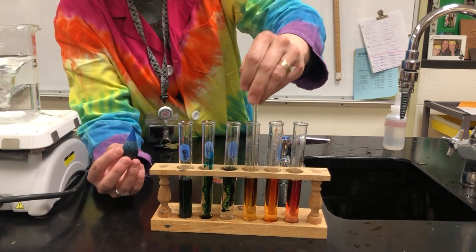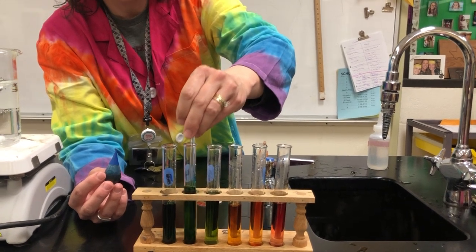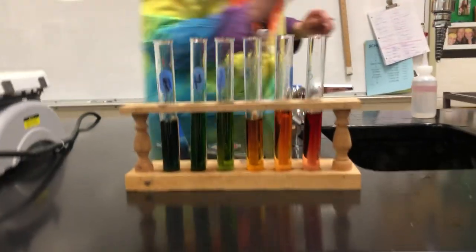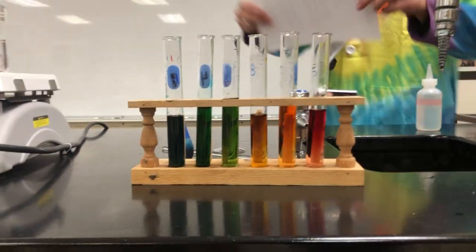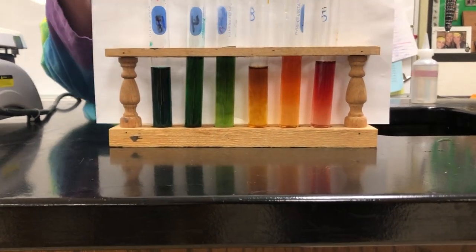Now we can almost get the entire color of the rainbow out of this. Okay, I'm missing a little bit of some yellows in there, and maybe I don't see a strong purple, but I get a nice little rainbow. Let me get a piece of paper behind it, you might be able to see it better. But for this, she's laughing at me again.